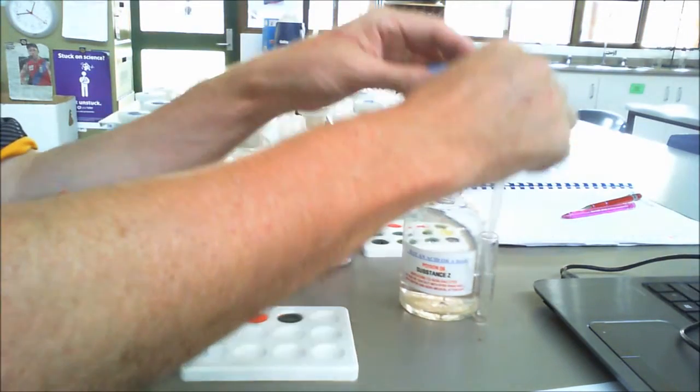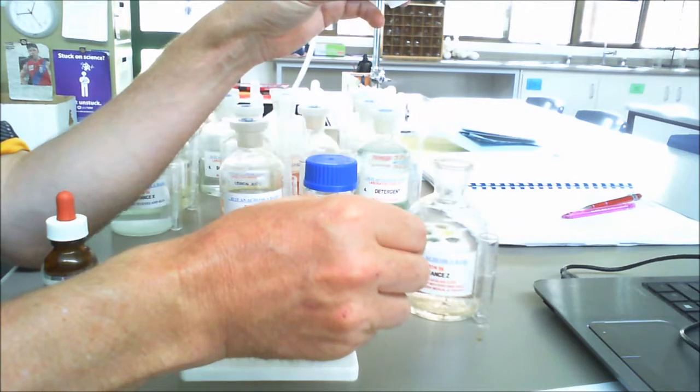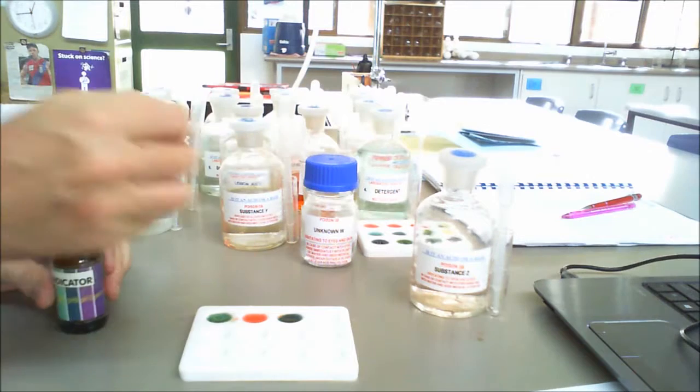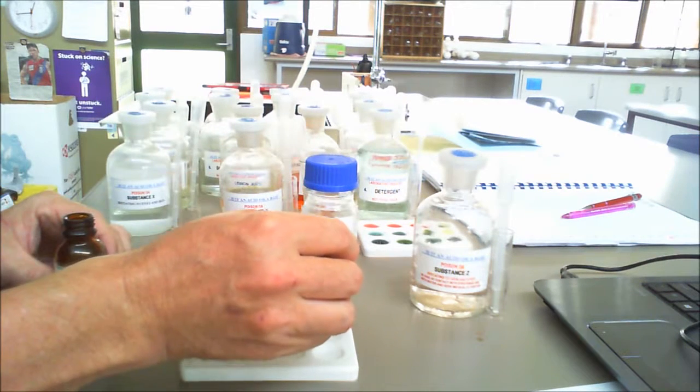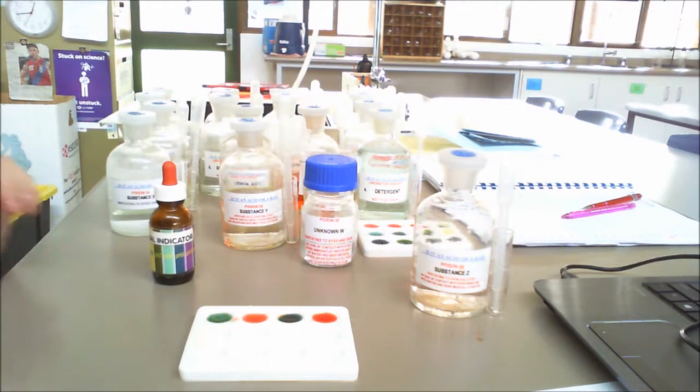And then finally our good friend Z, and we can see that it has gone red there, so you can make your mind up about those particular ones.